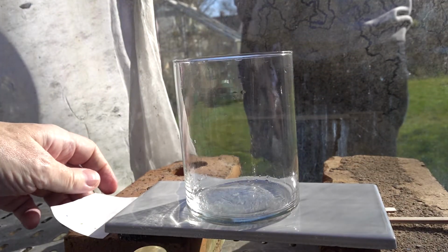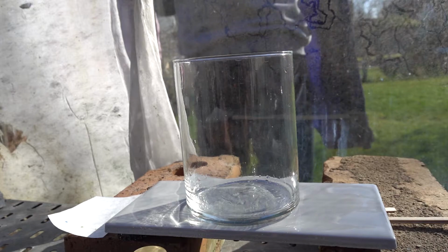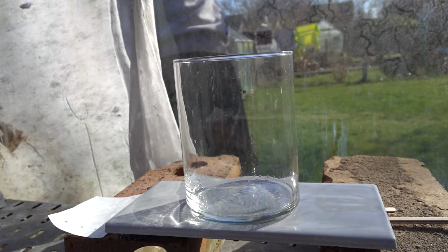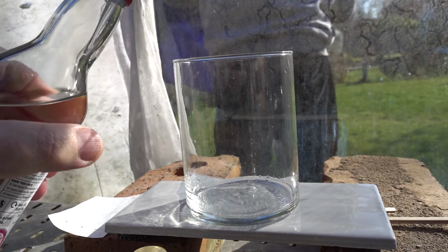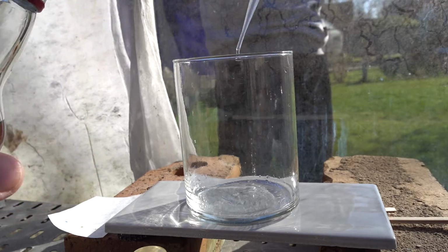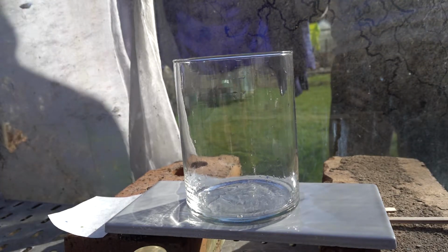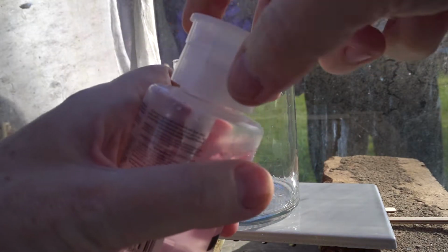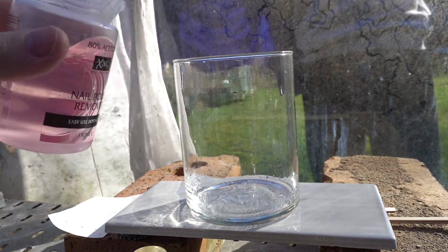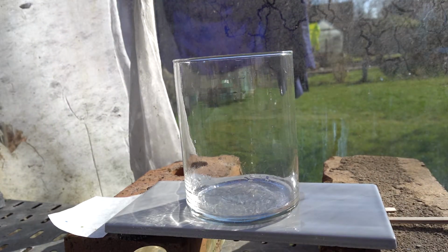Here's our chromatography tank. We're going to be using a solvent of ethanol, water and acetone or propanone. So we start with 2 centimetres cubed of ethanol water mixture, and we're going to add to that 4 centimetres cubed of acetone in water. At home this is a nail polish remover. And there we go, 4 centimetres cubed of that. Let's give that solvent a little mix.